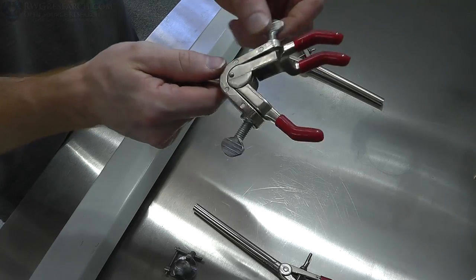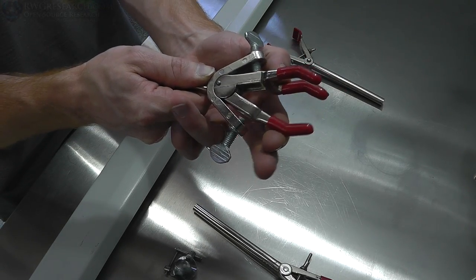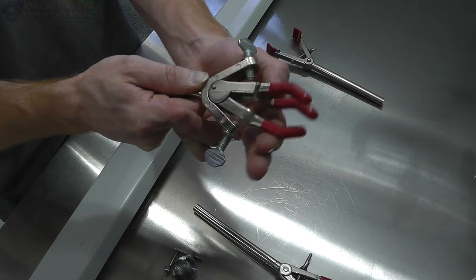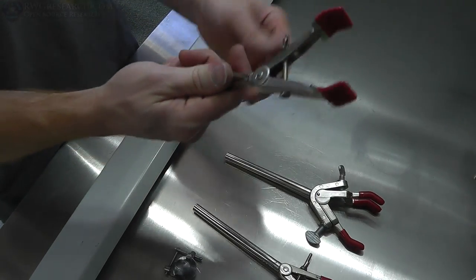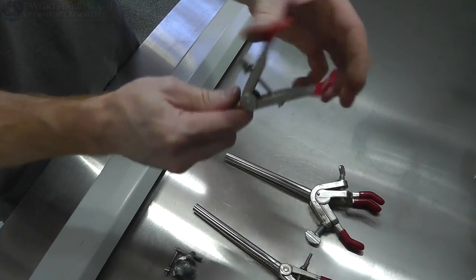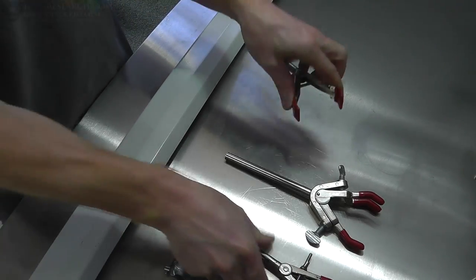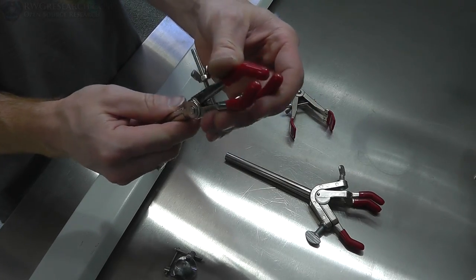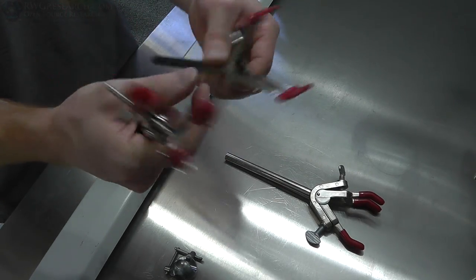However, in this case, you can actually bring in this one so far and then this one. And so you can actually move this where you want it, which is nice when this is fixed. And then this one's the same way as the first one, where this is solid and this is different. These don't hold as well, but they work fine for certain things. These three fingers seem to work a little better, just because there's a single point where this has to be nice and flat and perfect.